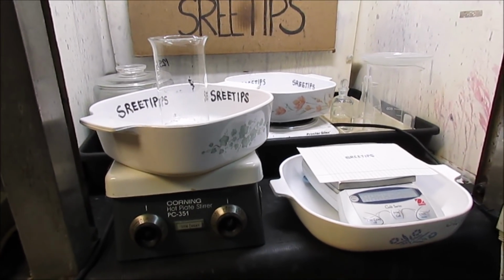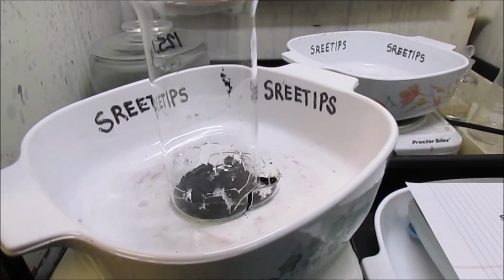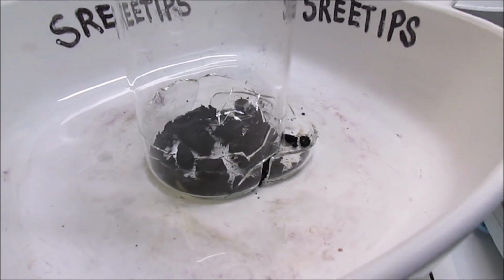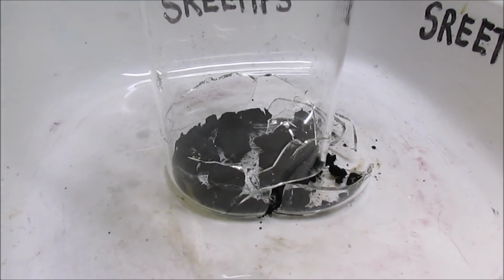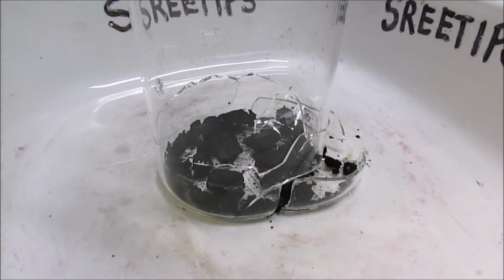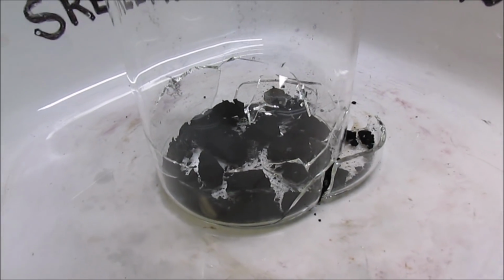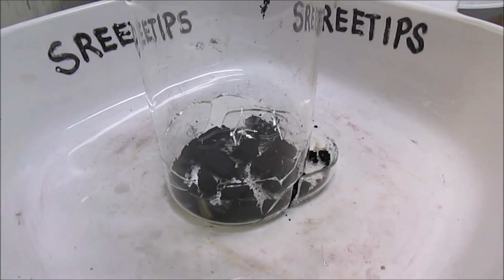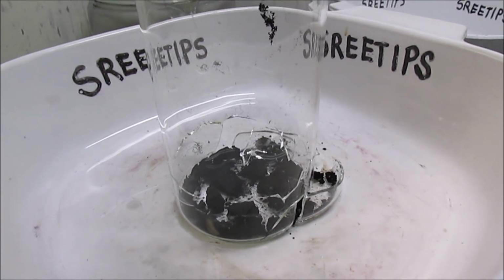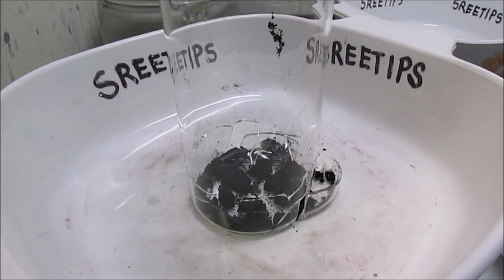Okay, finally got a moment of truth here. I come out to check on my mixed black PGM powders, and I've got a broken beaker. I have never ever experienced a broken beaker like this. I think this stock pot series is jinxed somewhat.